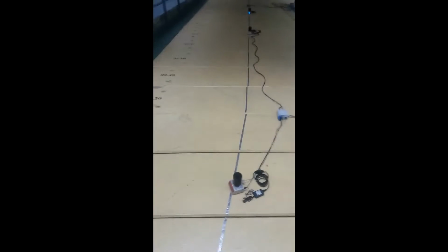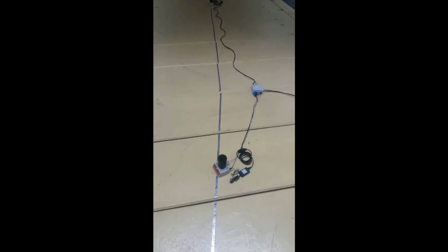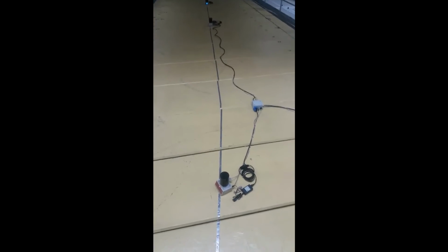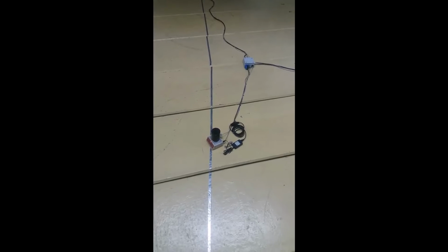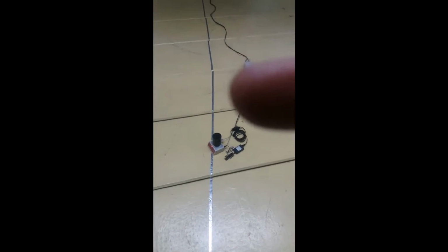Under this concrete roof you can find the storage ring with the electron accelerator, the EBS that has been presented by Harold today. And on this line you can see basically the trace of the electron beam.